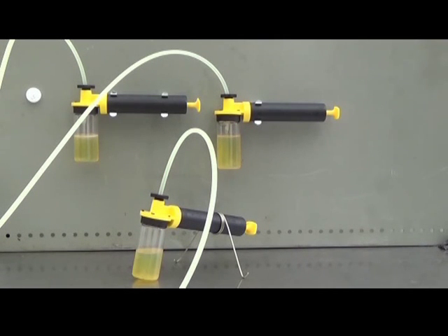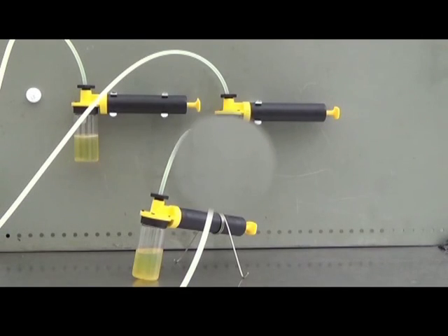The cold oil is now filling nice and evenly, and the other two are more or less completed. Now all the bottles have been filled and your job is done.